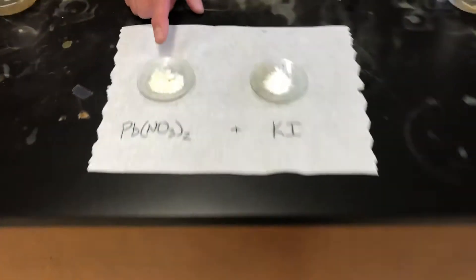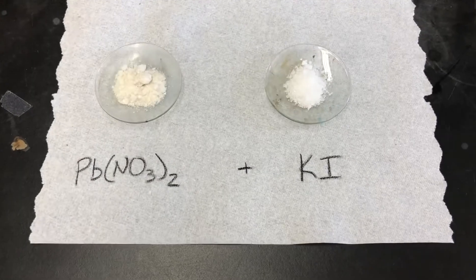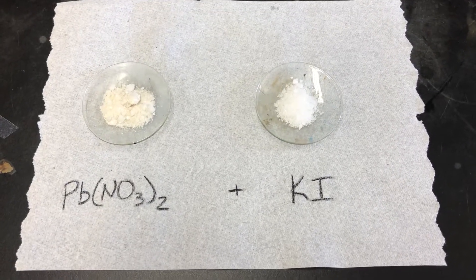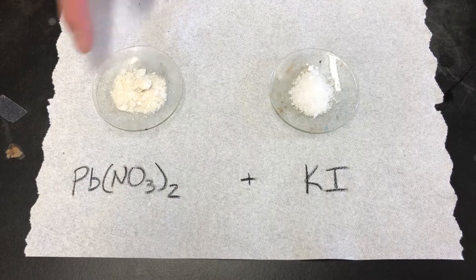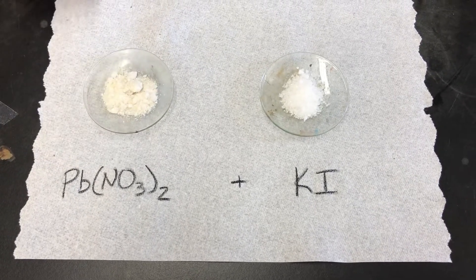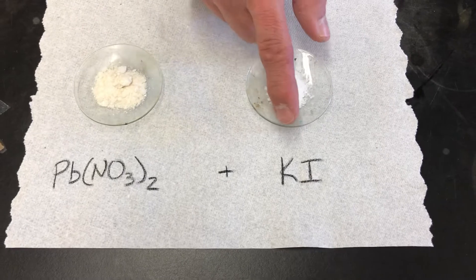I have two reactants. A reactant is something that goes into or starts a chemical reaction — it's what you start with. I have lead nitrate, which is Pb(NO₃)₂, and then I have potassium iodide, which is KI.